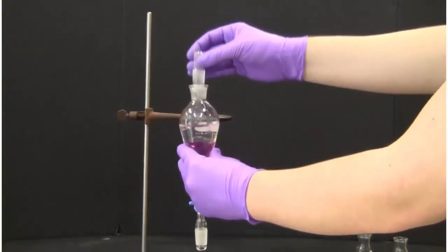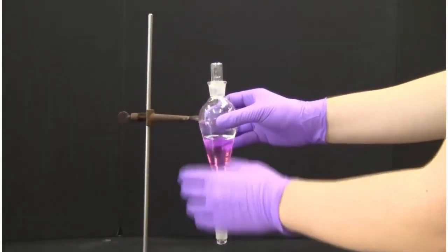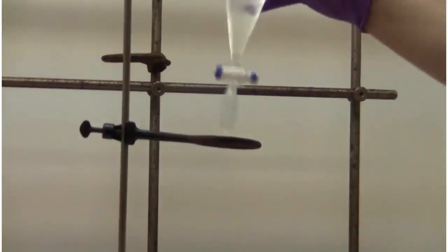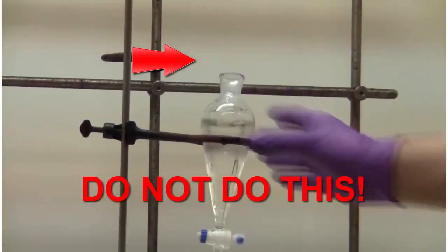Secure the stopper on the funnel, holding the stopper firmly by wrapping your fingers on both sides. Pressure will build up so be sure to hold the stopper tightly in the funnel at all times.